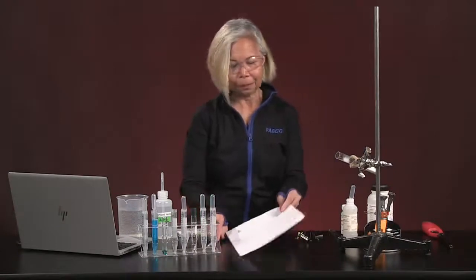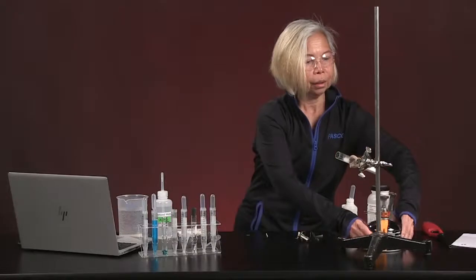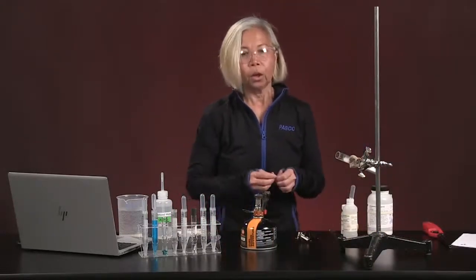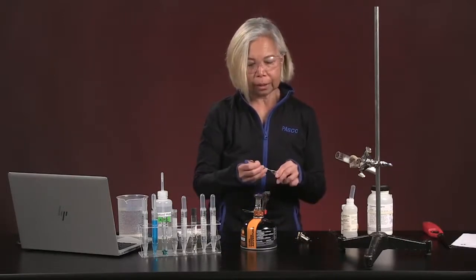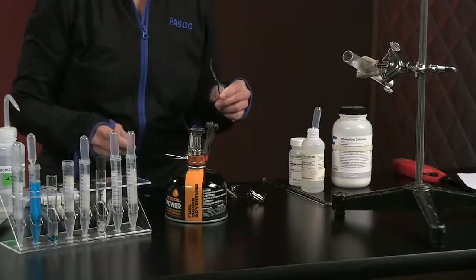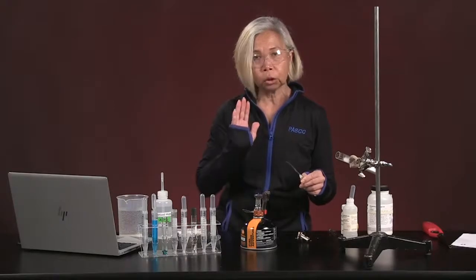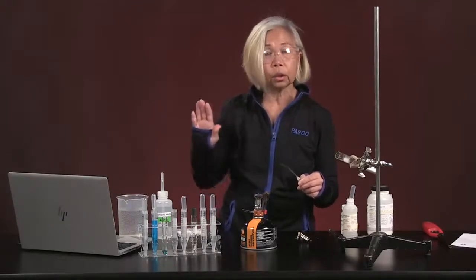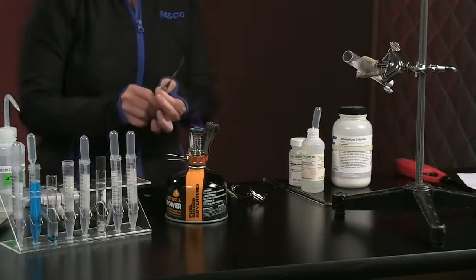Now, we are going to actually use our burner to do experiment H. Experiment H says, let's take a piece of magnesium metal and let's heat it up and see what happens. I will warn you, there's going to be a light produced, and this is the time that you want to make sure you are not looking directly at the light. So let's turn this up again. Stand away.